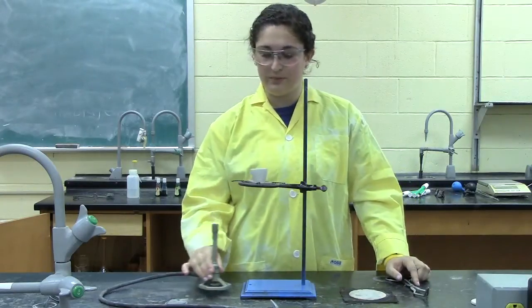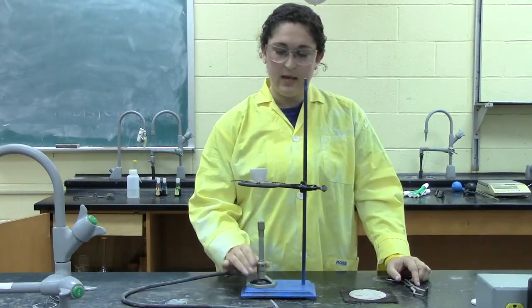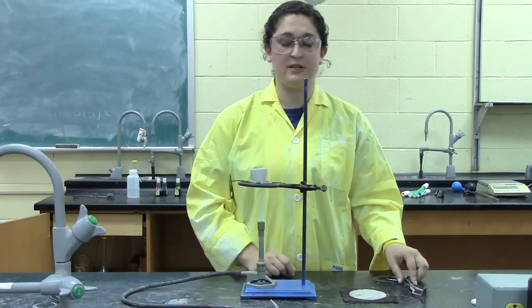Now you can move your Bunsen burner over and heat your crucible to get rid of impurities and to dry it.